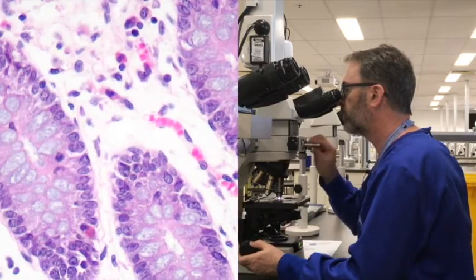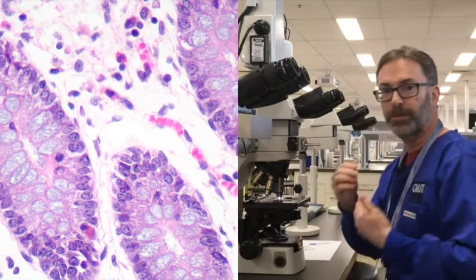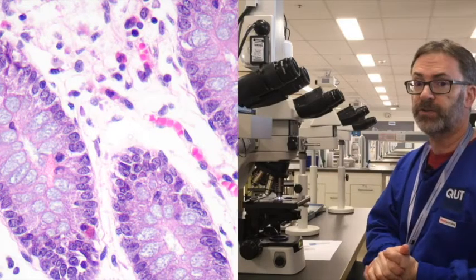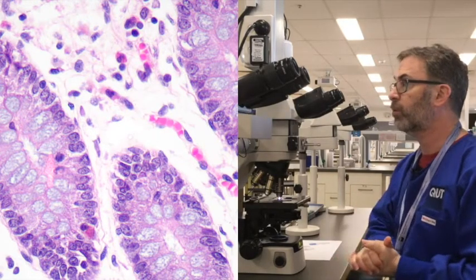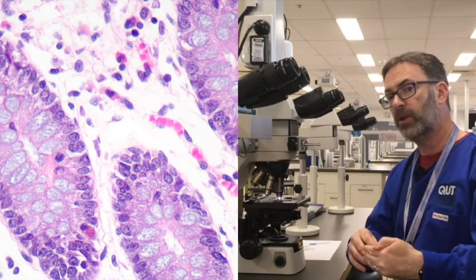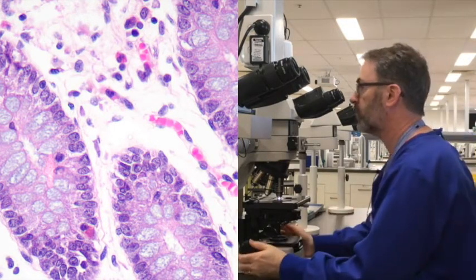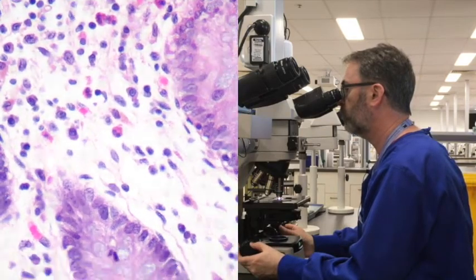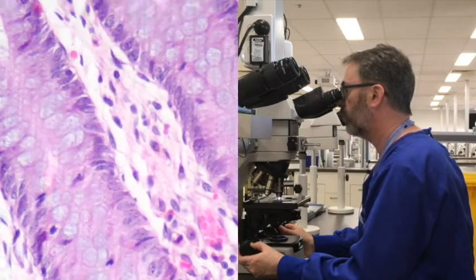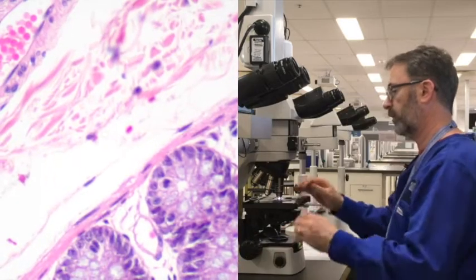You may be able to make out a slight hint of blue within the goblet cells. There's often a bit of debate as to whether that's appropriate. There is no real one answer to that. Some pathologists and researchers will like to see a little bit of hematoxylin staining there, but certainly if you differentiate that slide further in the acid alcohol, you can effectively remove that. But I actually quite like this. This is a good balance between the hematoxylin and the eosin, demonstrating all the features that you would want to see in a nice H&E stain slide.